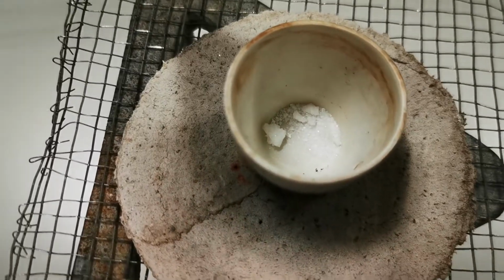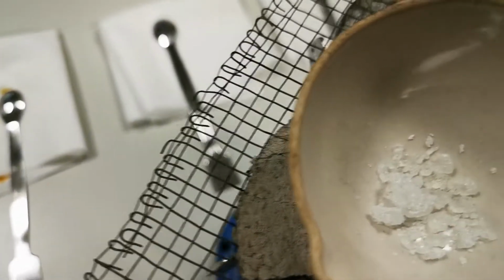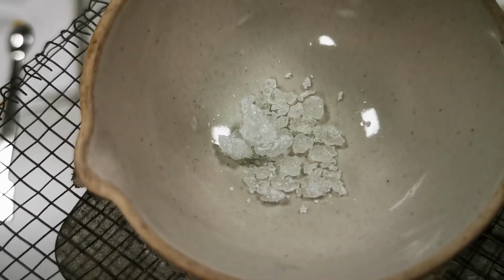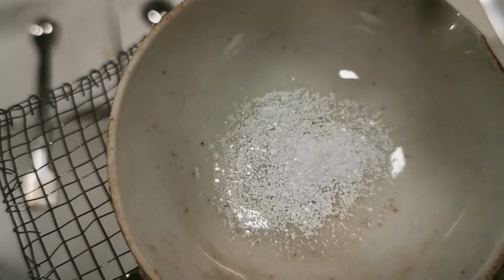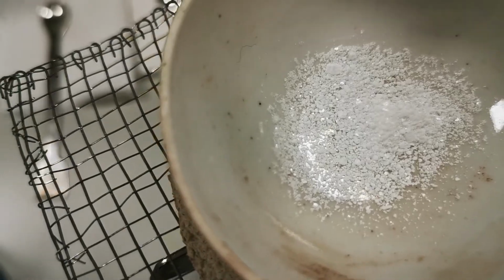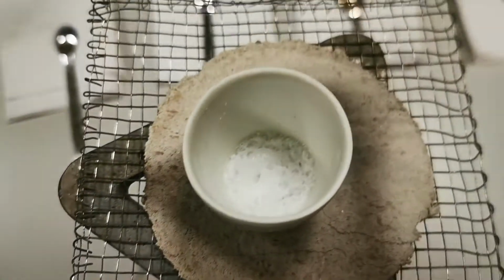I now started to heat the barium hydroxide hydrate. Now I'm going to show you the second one, the aluminum nitrate. You can see that the crystals started to lose their water. This one also, I can see this is calcium chloride. I can see that I have the crystals turning more into powder because they started to lose their water molecules. This one is very fast.